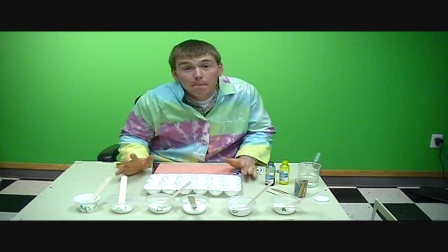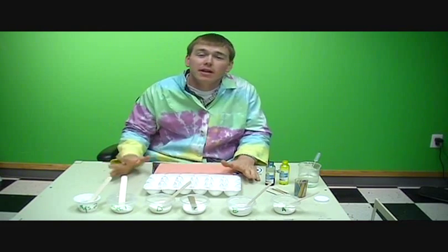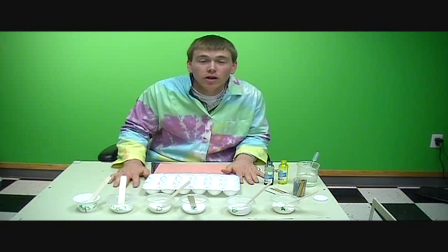So I've got the lab coat on again, so it's potentially going to be another messy lesson. Hopefully it won't be if the students are careful with this. And this is our mystery powders lesson, another really fun one for students. They are going to be forensic scientists today trying to solve the Mansfield murder mystery.